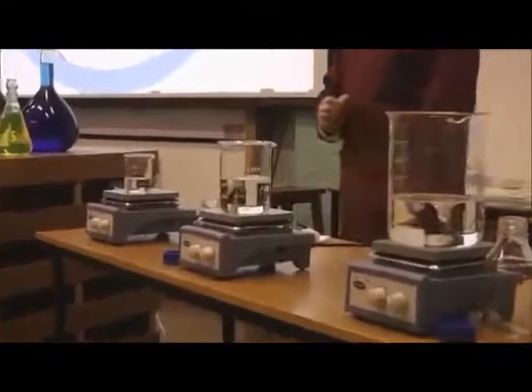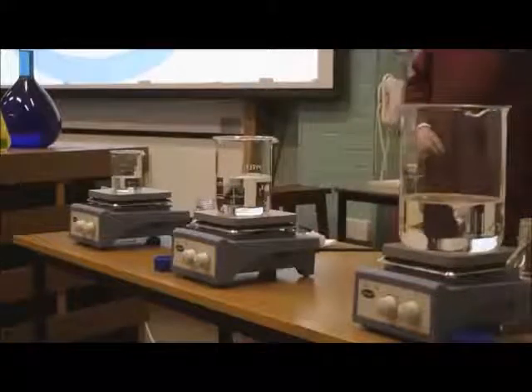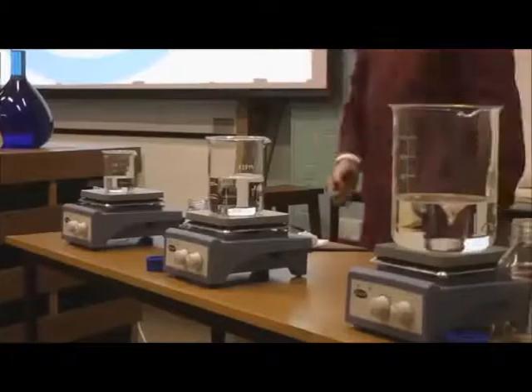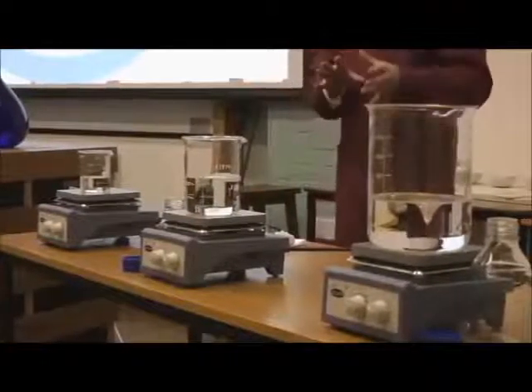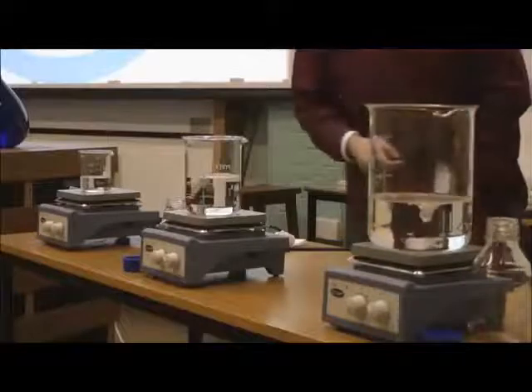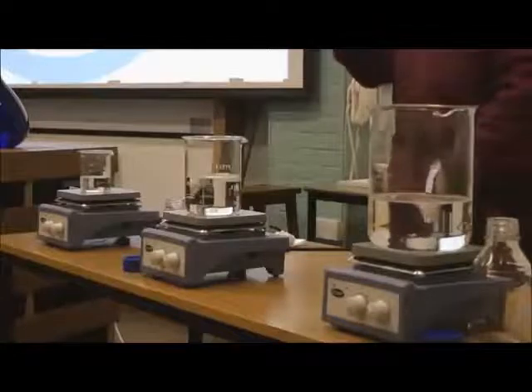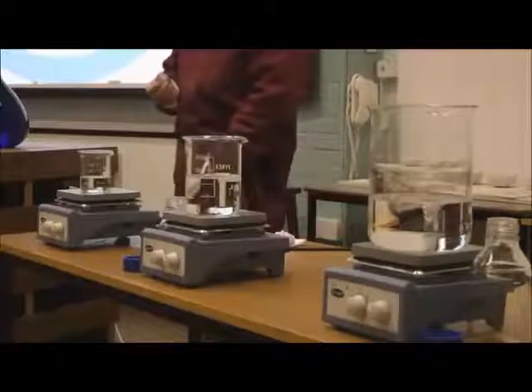Go on, a bit more show of hands, a bit more confidence. It's going to take longer, it's bigger, it's going to take longer. What about this one? Slightly less long. So now we've got to keep our eyes on what's happening. Does anybody think anything different? They react at the same time. So we've got a difference of opinion. Some people think it's going to take longer, some think it's going to react at the same time.